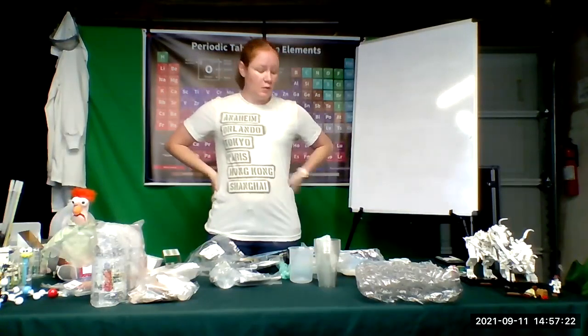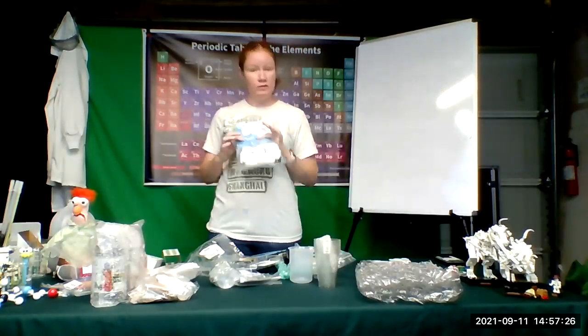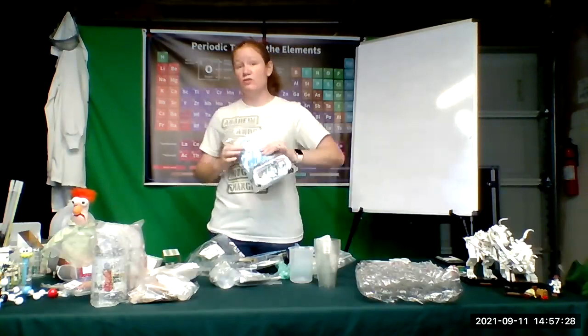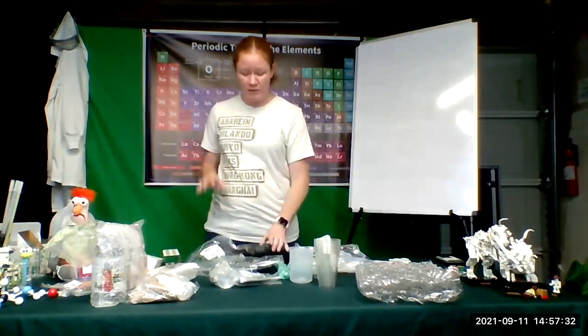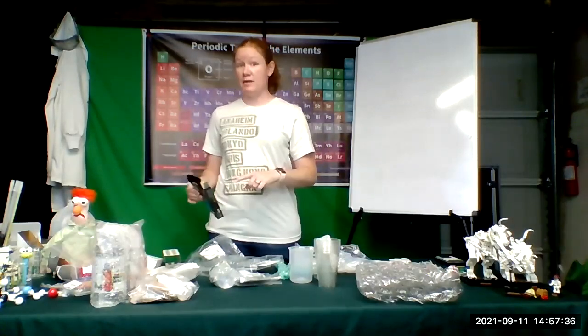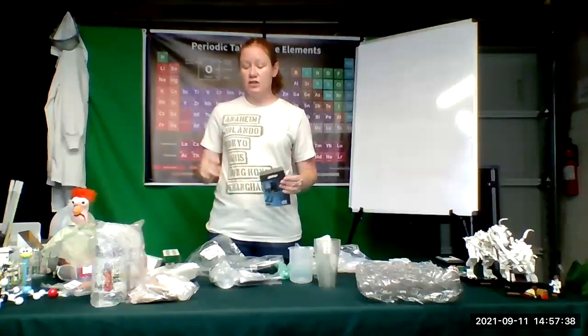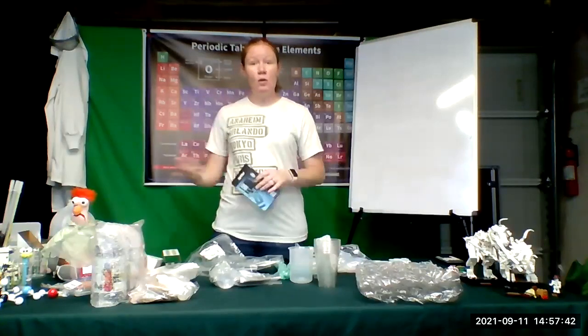Okay. The one thing you should be throwing away at the end of each experiment is the gloves. So use a fresh pair of gloves for each experiment. Don't try to hold on to the gloves from experiment to experiment. But the rest of your equipment, the rest of your materials, you will need to use from experiment to experiment. Okay. So make sure that you are cleaning them each experiment, saving them, and then holding on to them for the future.